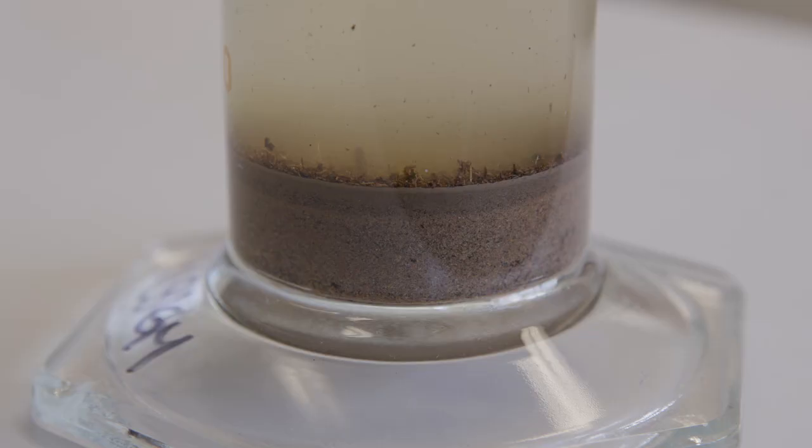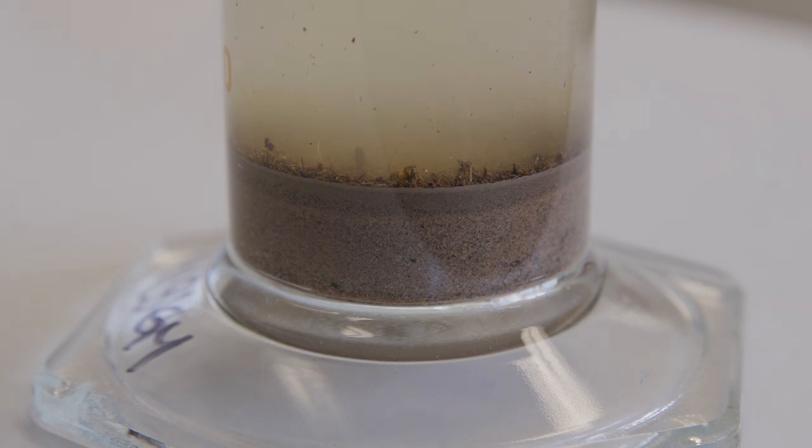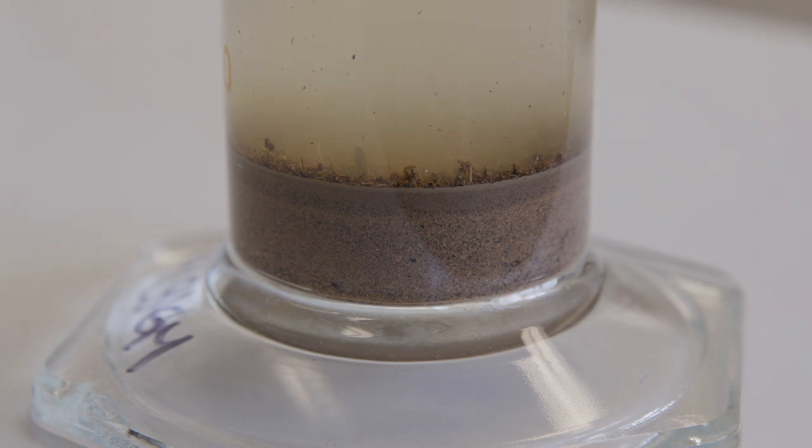As we mix up those soils in the water, we'll tend to find that the organic matter floats off to the surface, and as the soil settles you'll tend to find the sand comes to the bottom of the cylinder, followed by the silt, and the clay will slowly settle over the next 24 to 48 hours.